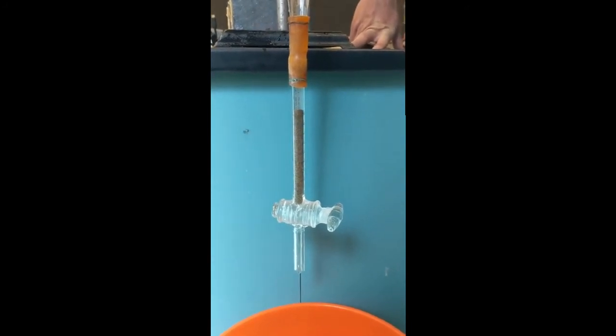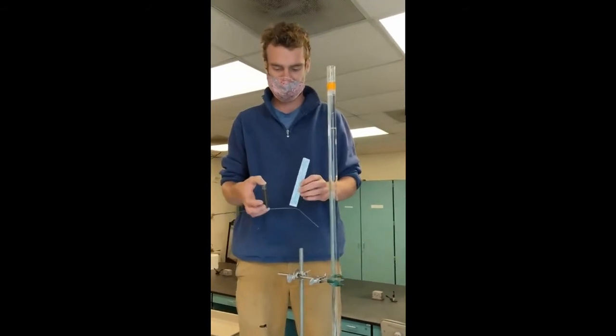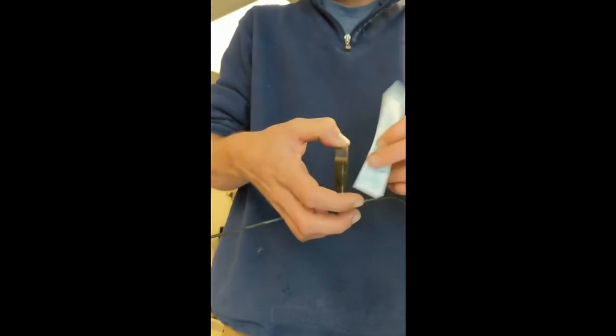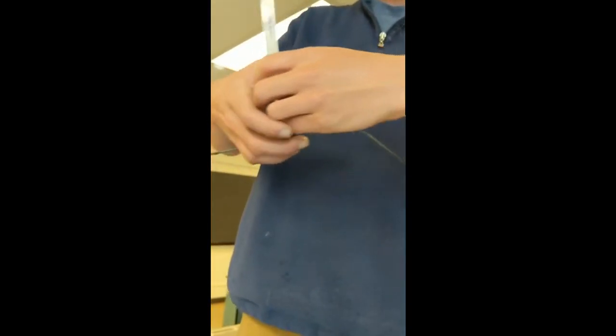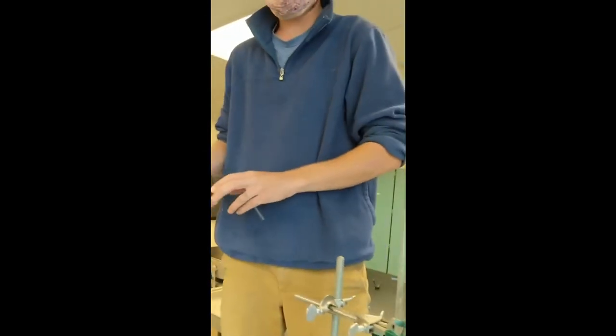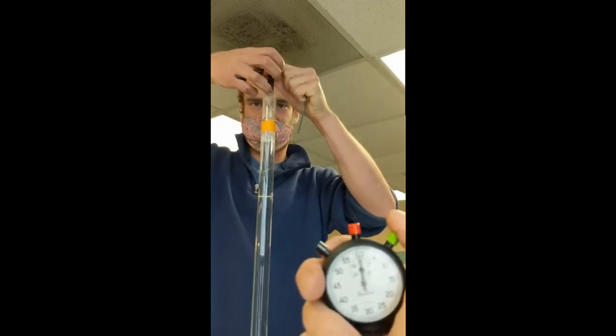You'll see the difference. So let's compare our sandy sample that we just did to a sample from a very muddy beach from Mission Bay. So we have to reverse that, Carl. You can read it, but we can't if you don't turn that around. There we go, thanks. So we have our initial height there of our muddy sample in the tube. We're going to do the same thing we did before. We're going to pop it into our settling chamber and start the watch when it falls in. Ready? Anytime.